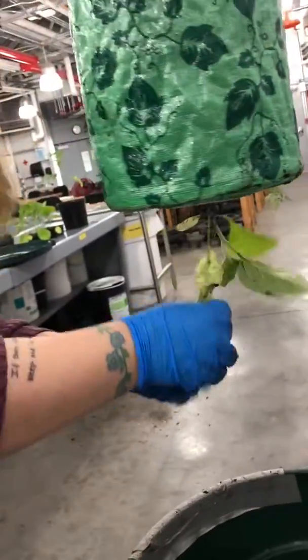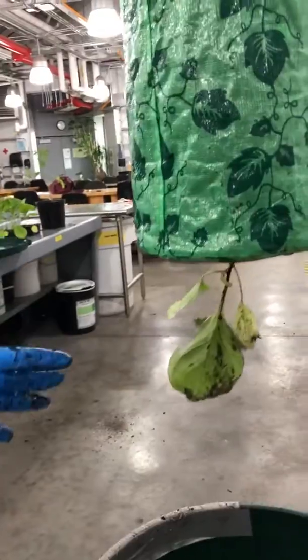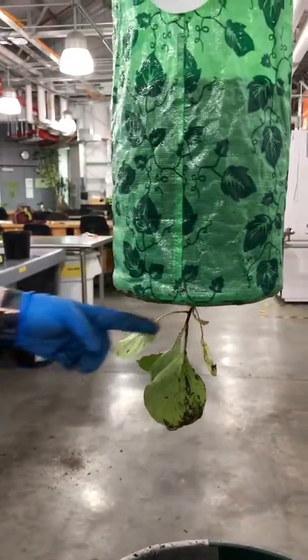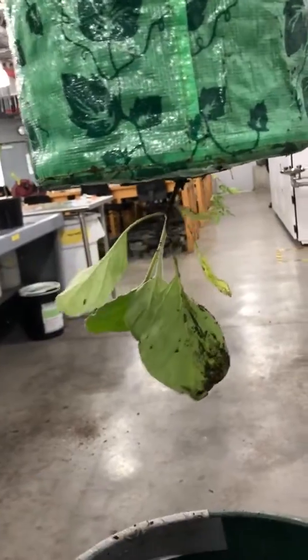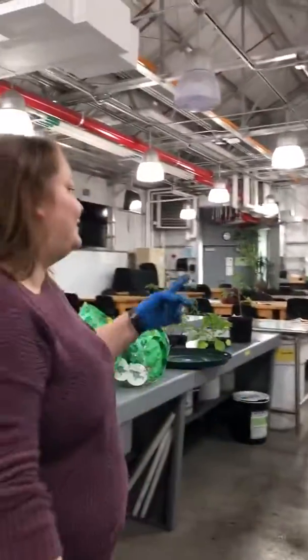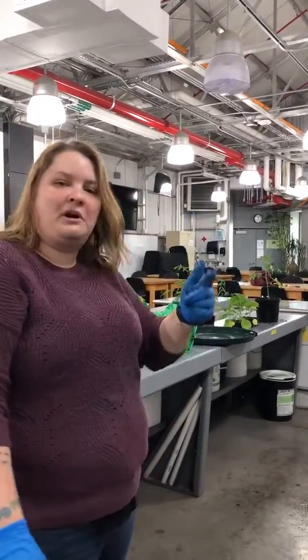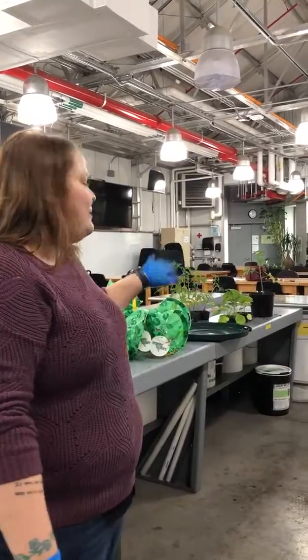So, as you can see right now, since they were growing in the greenhouse and just a normal plug, they were growing pretty straight, and now they're completely upside down. All right, so I get to do that for 4 more topsy-turvies, right? Yes. And pot up the normal ones, and I'll take some pictures when I'm done.